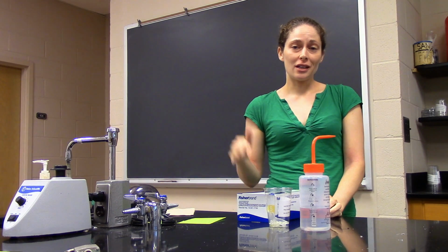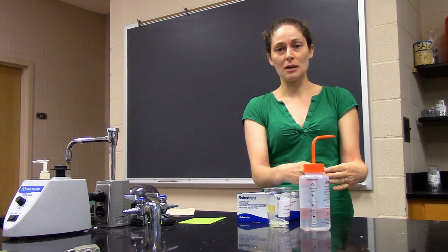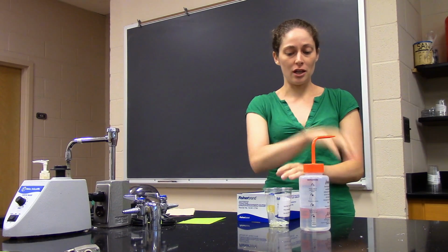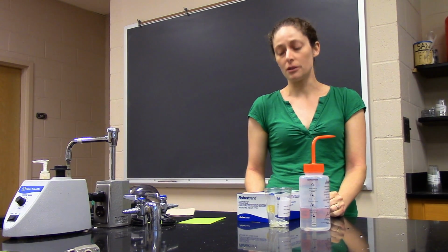Also, your experiments can contaminate your other experiments. If I have a control plate with one type of bacteria and another plate with a different type of bacteria, I want to be really careful, right? Obviously, any equipment that I'm using here and then using here, I want to sterilize in between.